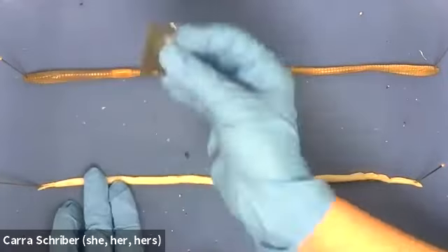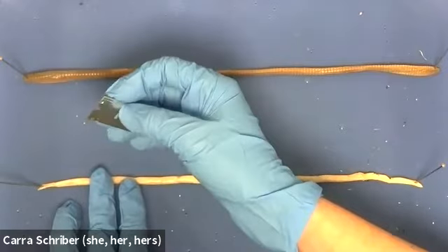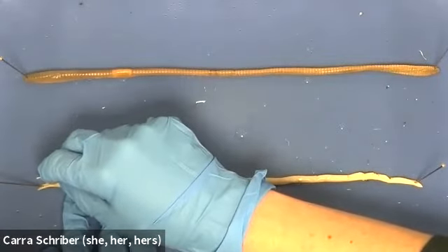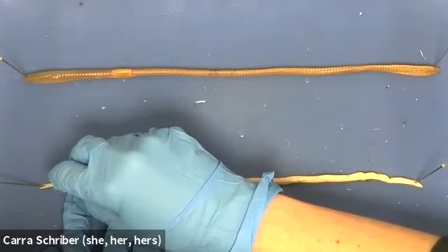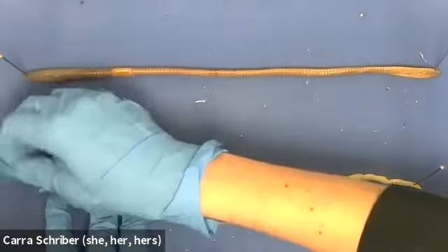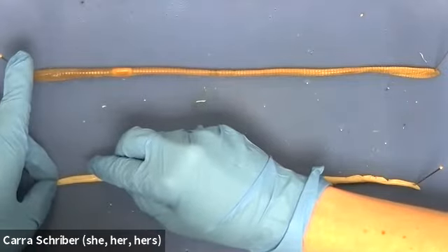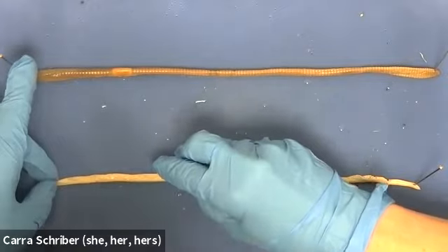All right, so I have this straight razor here, and this is my preferred tool for doing a dissection. They also have ones with handles, but for something small and linear like this, I really prefer the straight razor. I'm not going to put a lot of pressure here because, like I said, the ectoderm on this roundworm is really just a very thin sac for the organs. Just so I'm describing it to you, my straight razor is piercing the skin pretty easily.